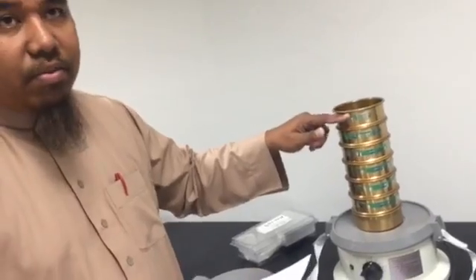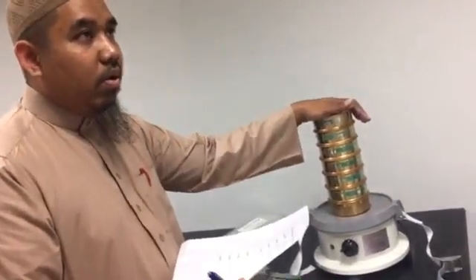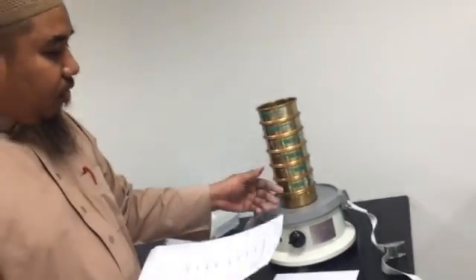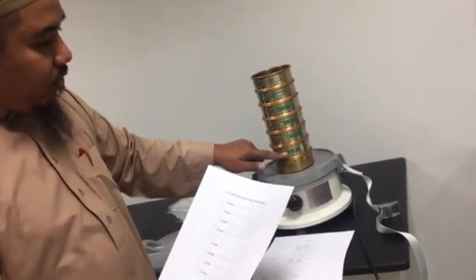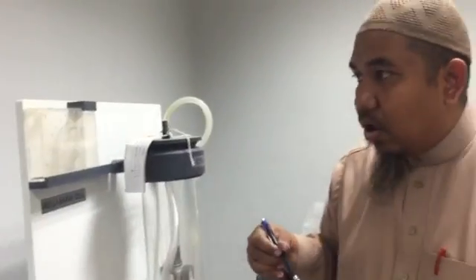Not in terms of the weight, in terms of volume, okay? So you collect 3 samples. I put 4 here, but let's do just 2 or 3. This one, this, and this. You collect the sample around that is enough for this.